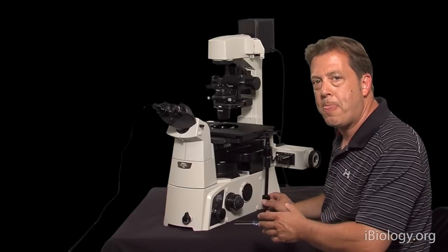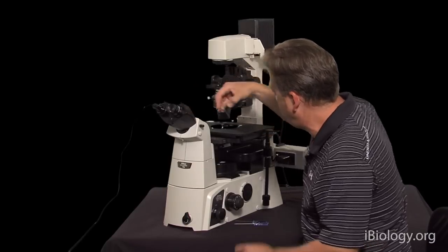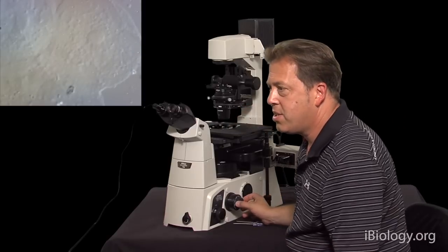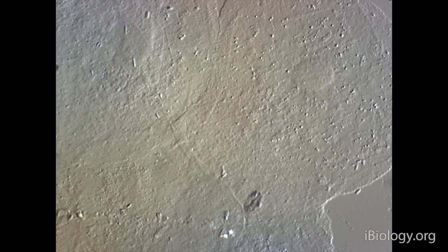Once you have extinction confirmed, you put your prisms in place. We'll switch specimens to a cheek cell preparation to see DIC working. You can see these cells in DIC on the camera — the nucleus is visible and you can see a sort of three-dimensionality. If you're at extinction, you really don't get much of an image. What you need to do is move the polarizer slightly off extinction, and now you get this nice three-dimensional look of the cells.